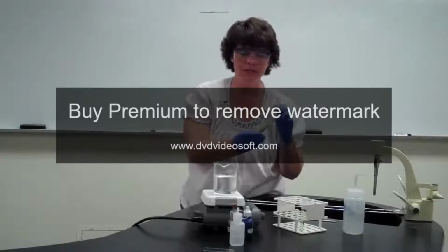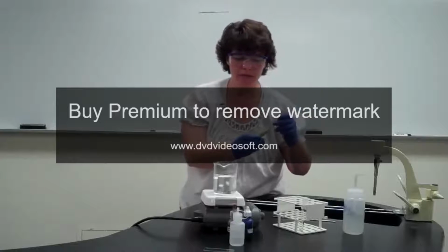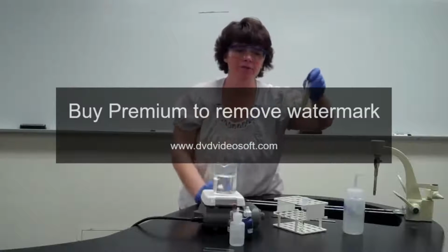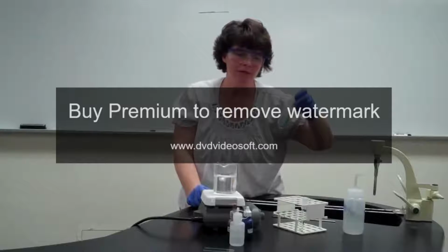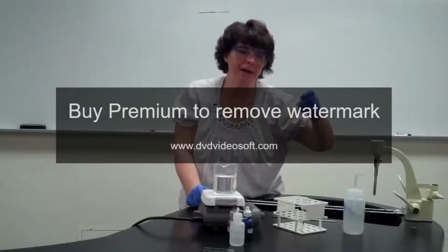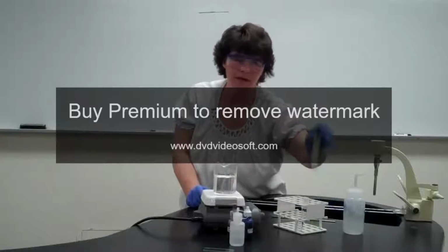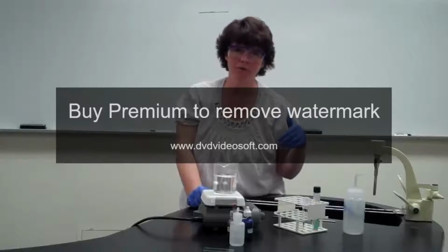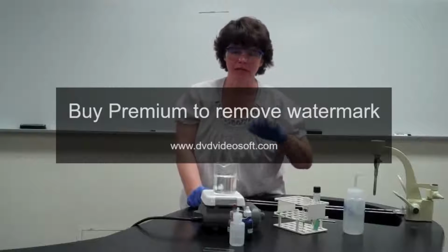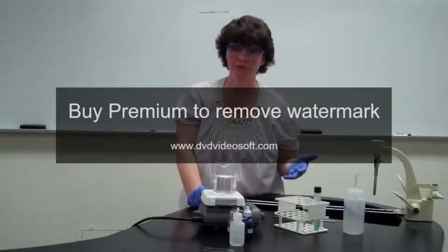So if we have to use these, just be really careful that when you take the bacteria off the top, you don't gouge the media. I wanted to demonstrate that people have used this in the past and did gouge the media. You want to get only bacteria, because otherwise you're going to be staining the media and that's not going to look like bacteria. Hopefully it works out to where we're going to use these, but if not, we will use these. Because it's taking from a solid, you'll have to do that technique of putting the water in first, adding the bacteria, and then spreading it around so that you get a single layer of bacteria. Once again, because it's kind of chunky, that's going to be a little bit more difficult than what we've seen in the past.